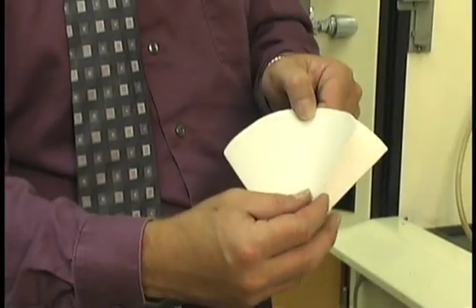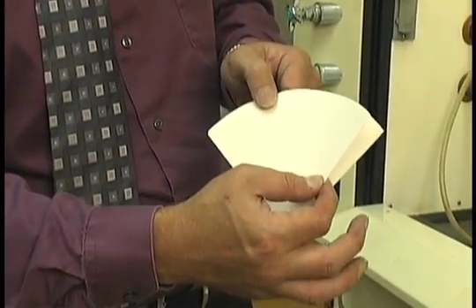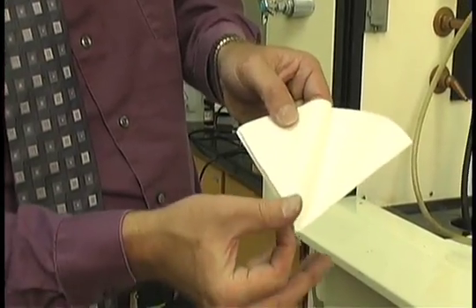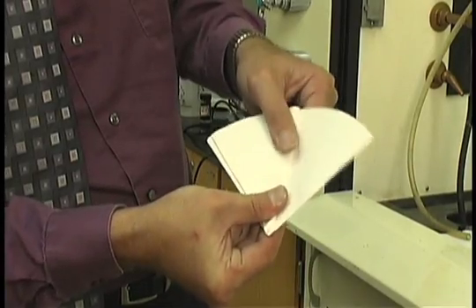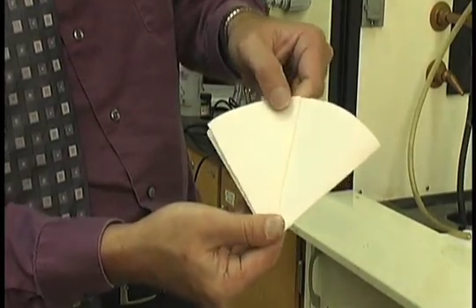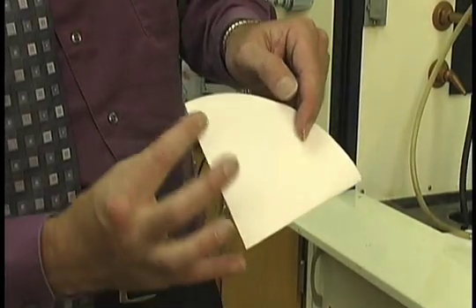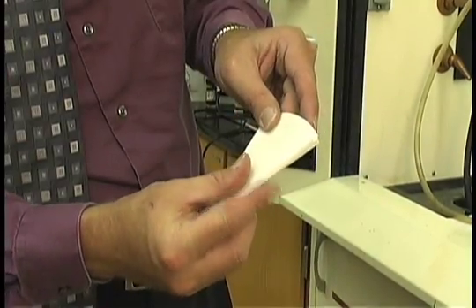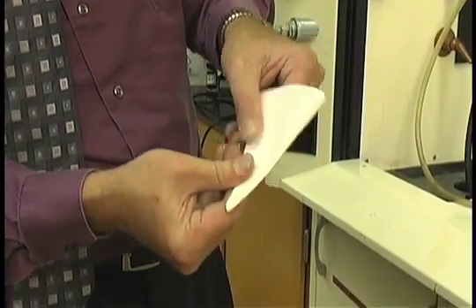Take the outer edge of one of the sides of the filter paper and fold it to the middle edge and once again crease. Turn it over and do the same thing. The outer edge, fold it to the inner edge and crease.